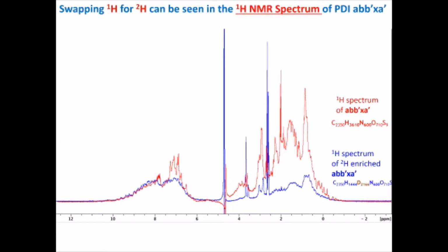So what happens when you swap hydrogen 1 for hydrogen 2, hydrogen for deuterium, in a proton NMR spectrum for PDI? Well, the red spectrum is the normal spectrum with hydrogen H1, and the blue one is a proton NMR spectrum of deuterated PDI, PDI enriched with deuterium. You can see that deuteration is only 60% efficient, and only non-labile hydrogens that are not involved in exchanges are converted and will remain as deuterium. When there are exchanges with the hydrogens in the solvent, those will not get converted. So we are looking at a deuteration of non-labile hydrogens.